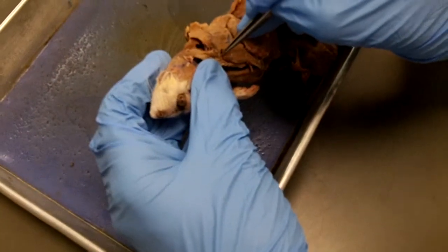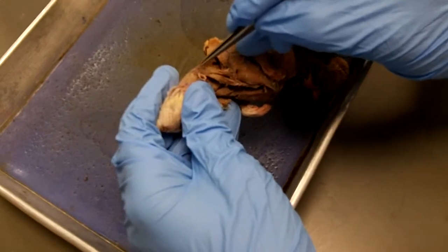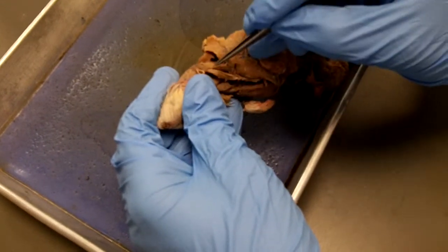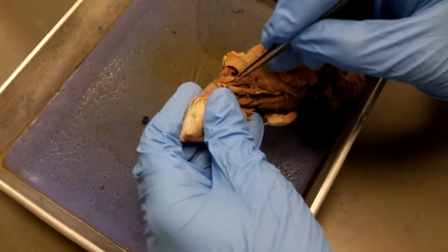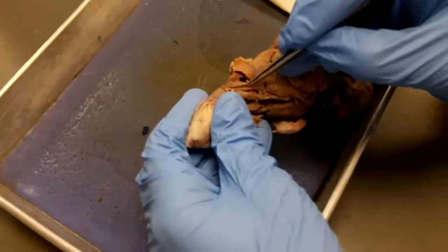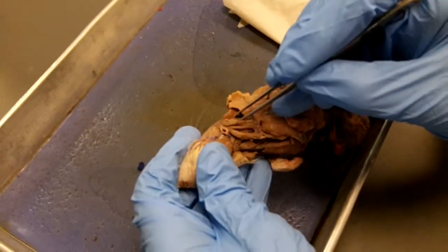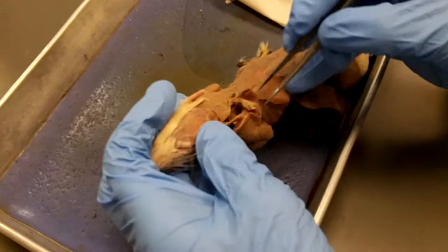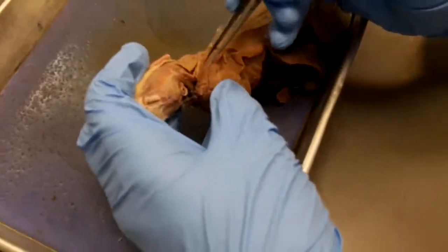Superficially we go the cleido from the clavicle to the cervical region of the skull. So that's cleidocervicalis. And then between them is this one. This is the cleidomastoid. So it starts in the same place as this one, but it ends in the same place as the first one. Okay. All right.